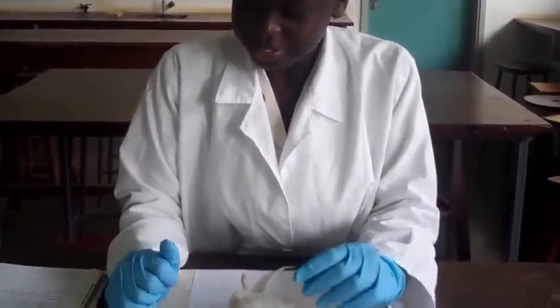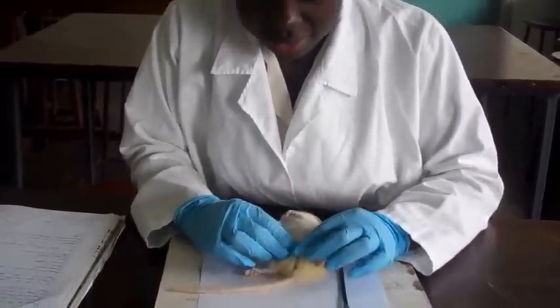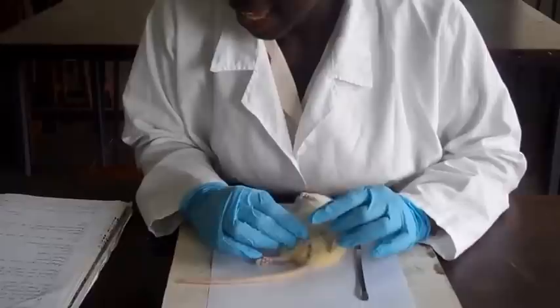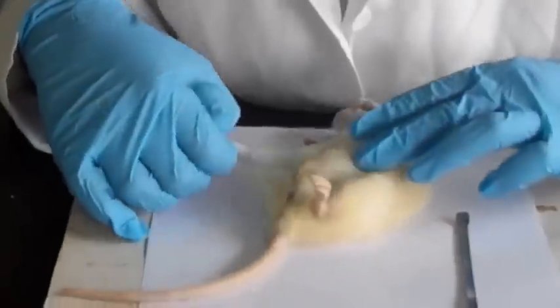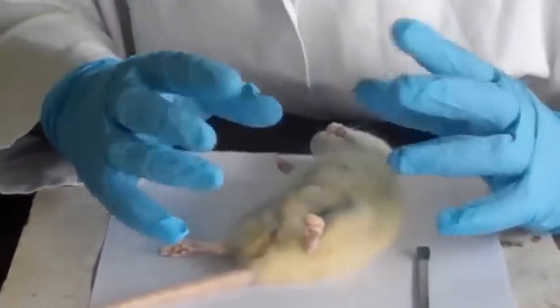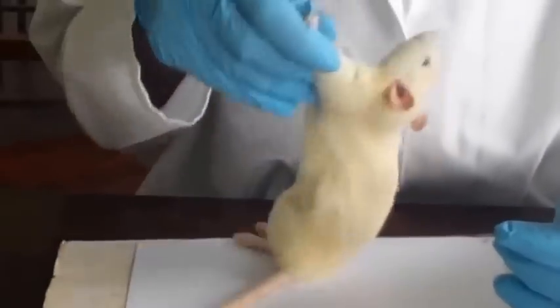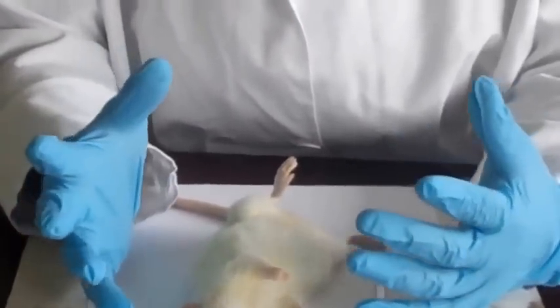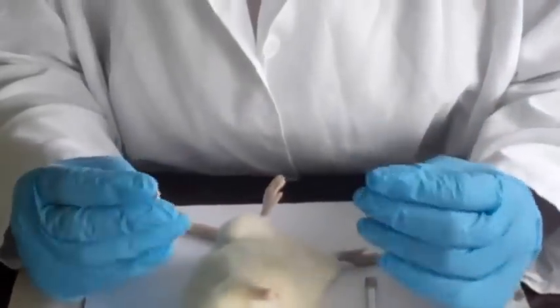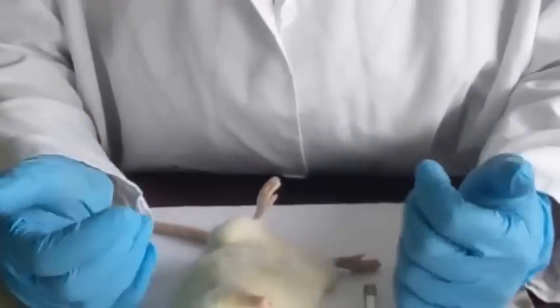The roles of the sex organs. Since this is female, our vulva, which you have already seen, and the vaginal opening are used for copulation. Our clitoris is used for sensitivity during copulation, and the nipples, I believe you all know, are for suckling the little ones, the young rats. And then if it were male, we'd have the scrotal sacs that protect the testes, the prepuce that protects the penis and keeps it moist for lubrication during copulation. And of course, the penis is used for copulation.